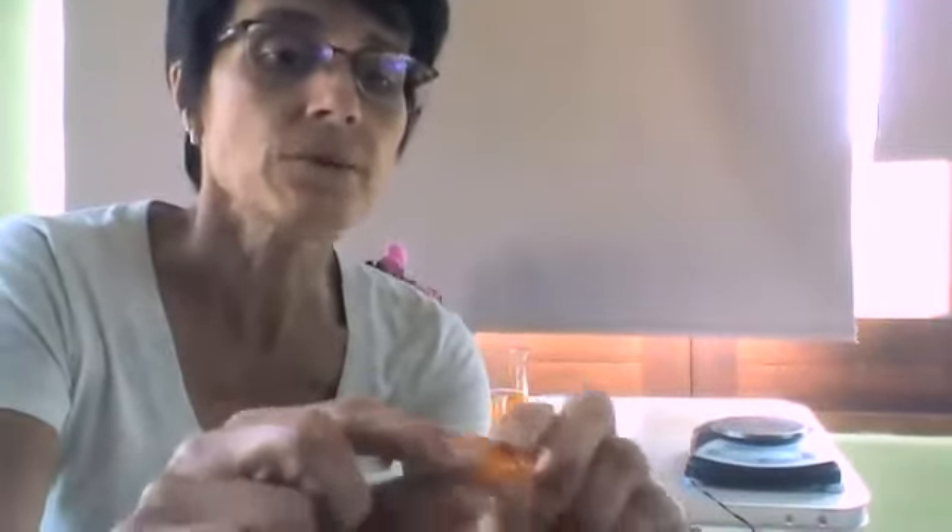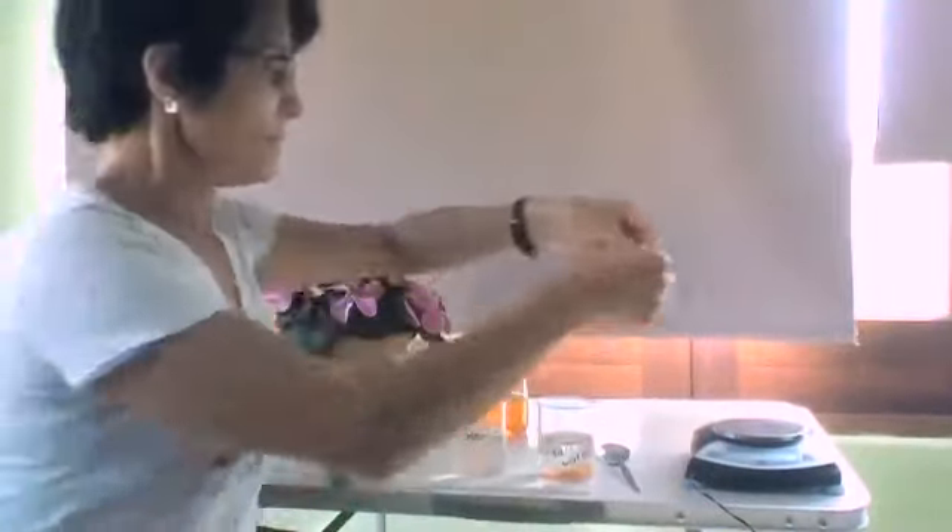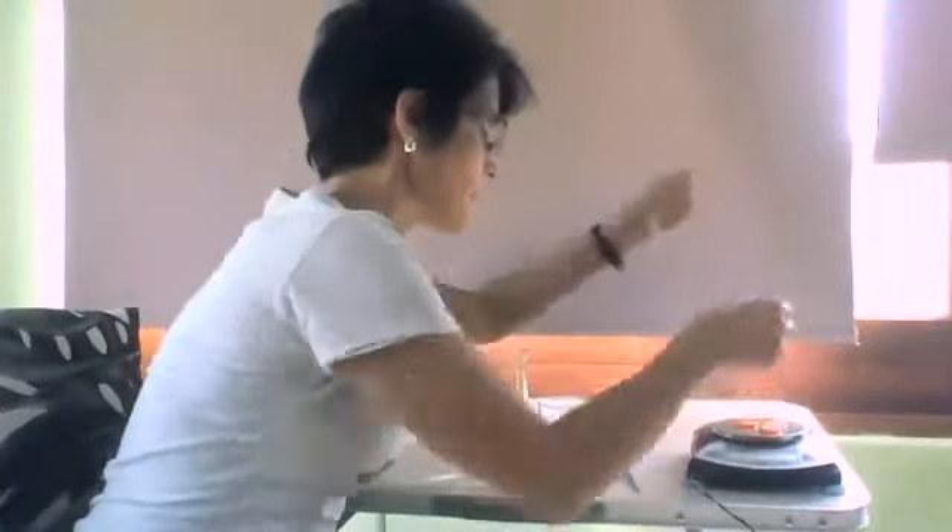Think of a carrot when you make salad or something — they are much, much harder. I'm going to weigh them. The mass is 6.68 grams.